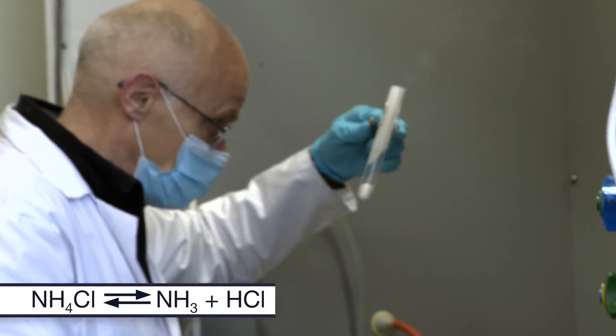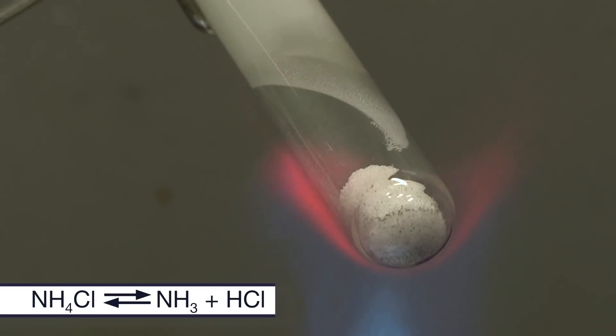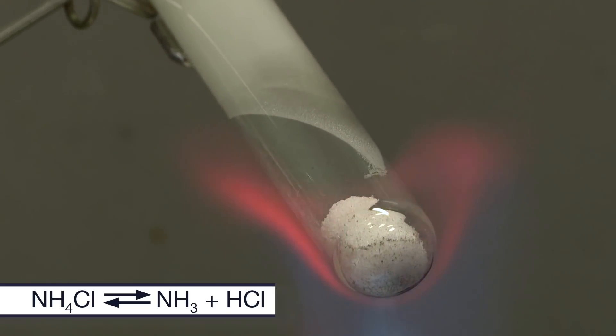So it's almost like a Star Trek teleporter. You're beaming from lower in the test tube to the top of the test tube, reforming as you were before.